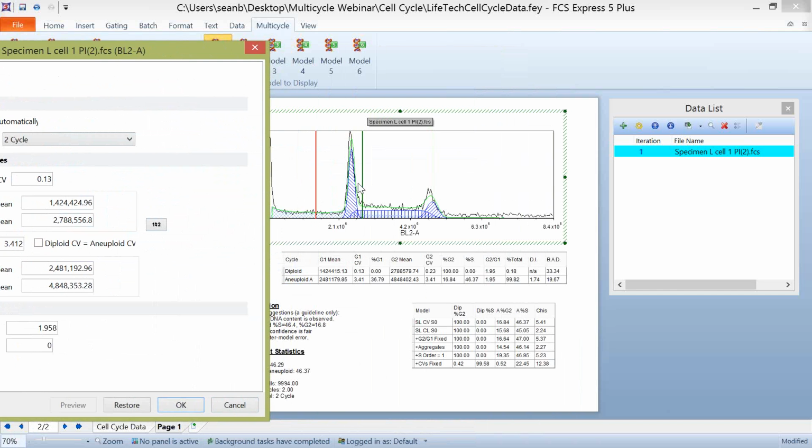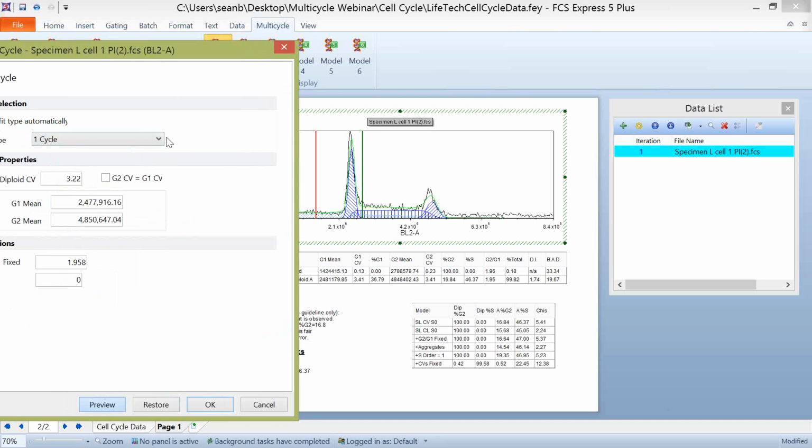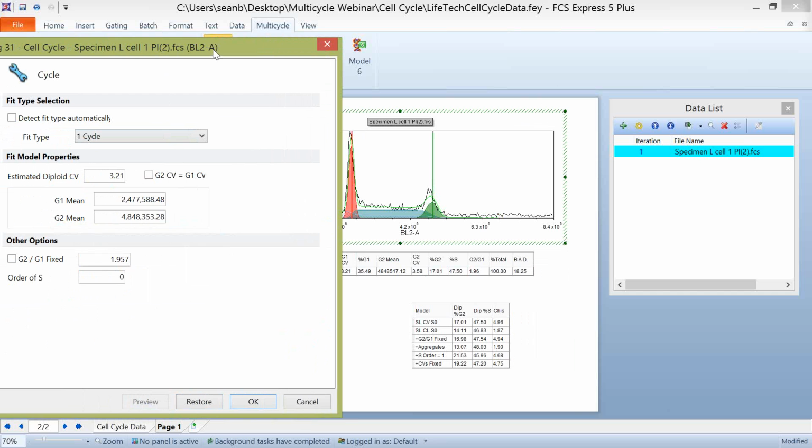But maybe you have a case where you have a 1-cycle fit and some data with apoptosis peaks, right? This is a great place to come in. You can say, let's see what a 1-cycle peak looks like, and then let's also see what a 1-cycle peak with an apoptotic overlay looks like. So you can pick and choose. You can have multiple multi-cycle plots within FCS Express. You're not limited to just this one plot. If you want to look at 1 cycle in one plot and 1 cycle with an apoptotic overlay in another plot, you can do that on the same page to get an idea of what makes sense for you to use.